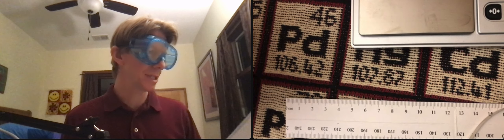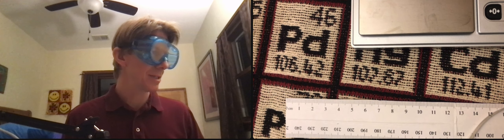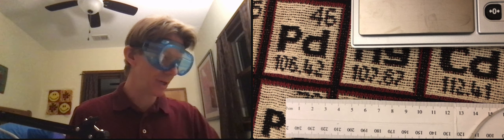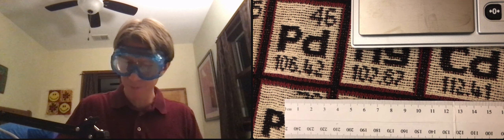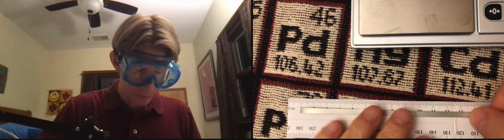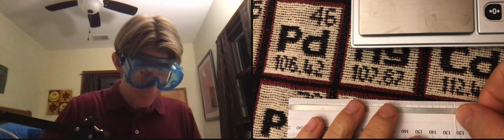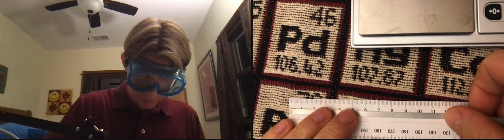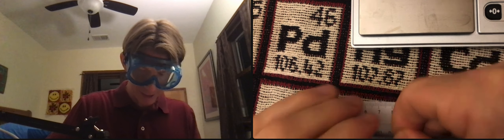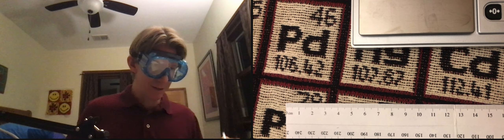A single replacement reaction: cut a piece of magnesium ribbon that is approximately 8 centimeters long. So let's see, I've got my ruler here. And I'm going to get to about 8. And again, the exact length doesn't matter.